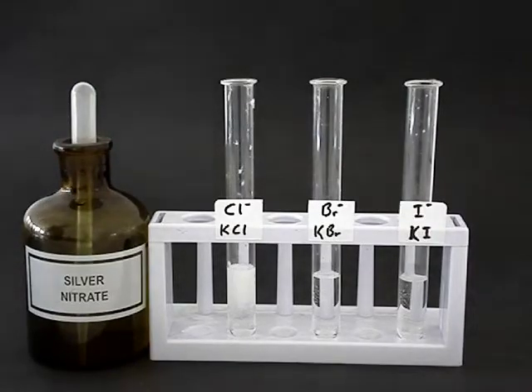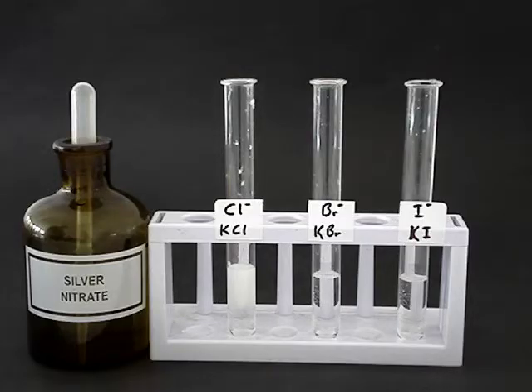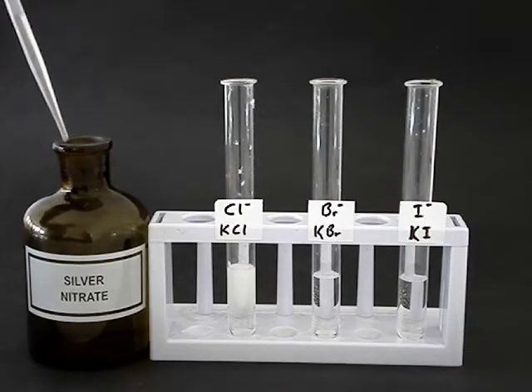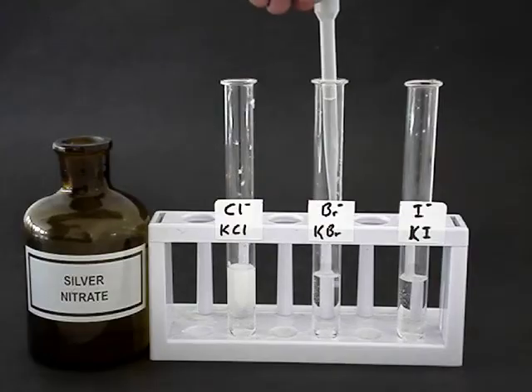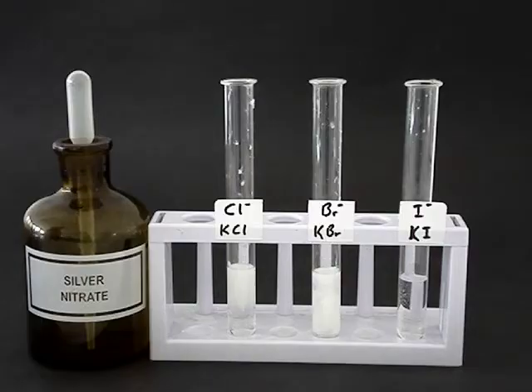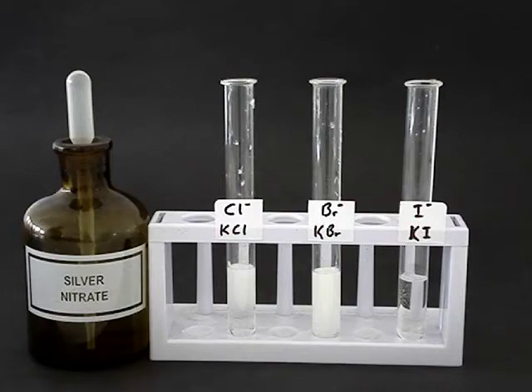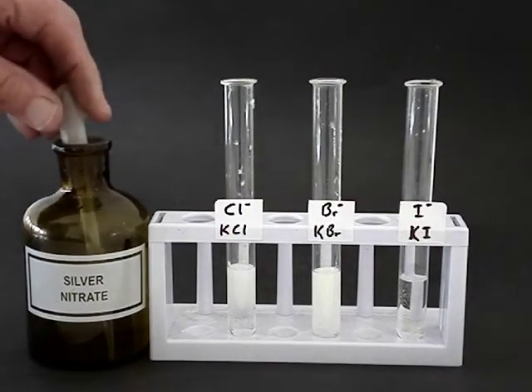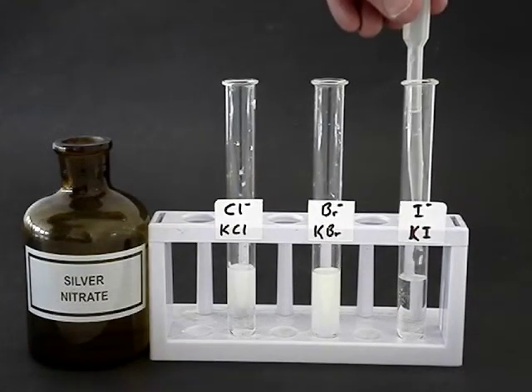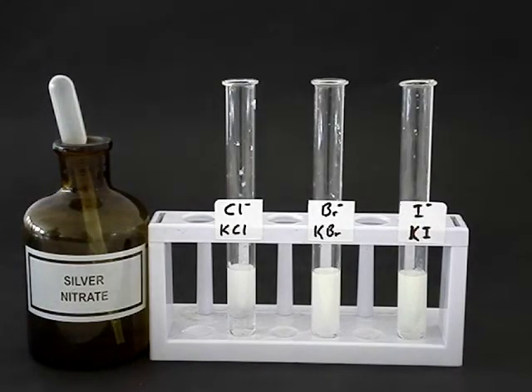Silver chloride cannot dissolve, and so that's why it comes out of solution and is visible as a white precipitate. We add some silver nitrate to the bromide, and we notice that it turns a bit of a darker color than in the case of the chloride — we call it cream colored, and that cream color is silver bromide. Now we add some silver nitrate to the iodide solution, and the color turns even darker — yellowish. That yellow color is silver iodide.